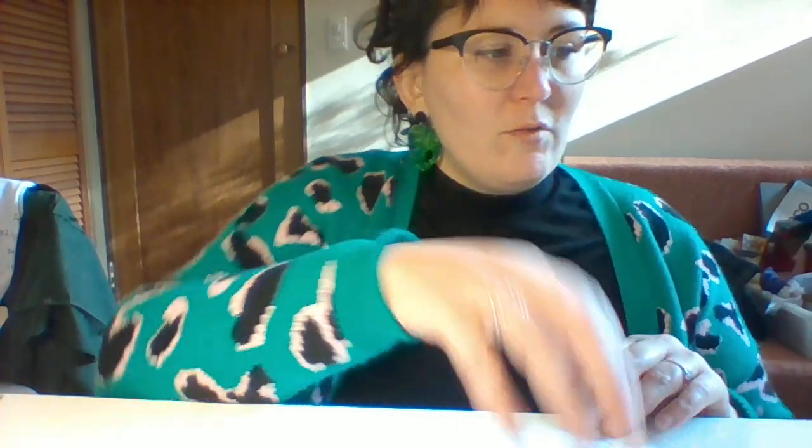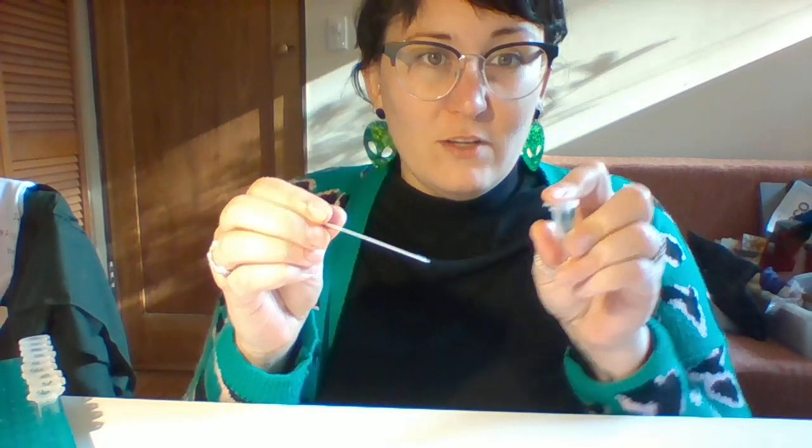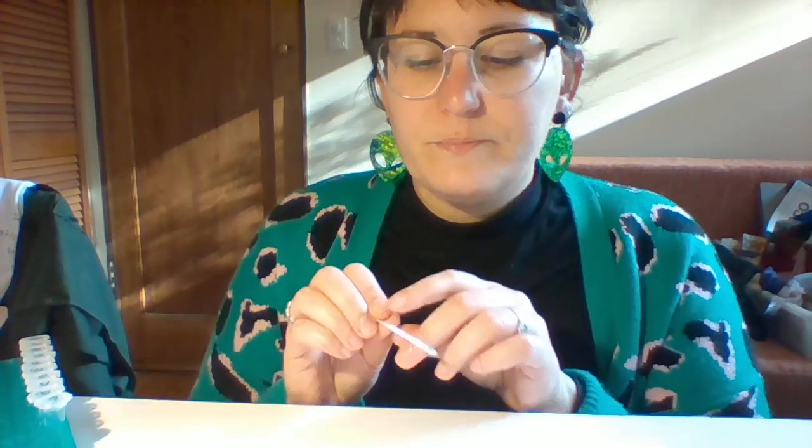So, first test. I'll show you the first test, and then the rest I'll just pause the video and wait 30 seconds and show you the results. So I've got my patient A, 6:30 a.m. This is the first one we're doing. Dipping it in to the blood plasma, which as you can see is not blood red, because the blood plasma is the yellowy clear solution that is extracted out of blood when you spin it down in a centrifuge. All right, so I'm going to wait 30 seconds.